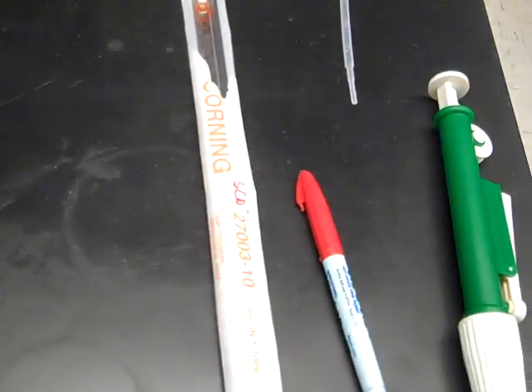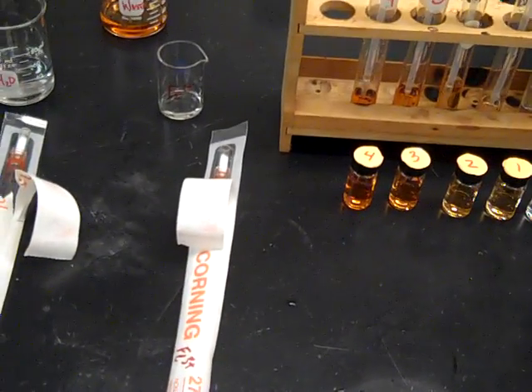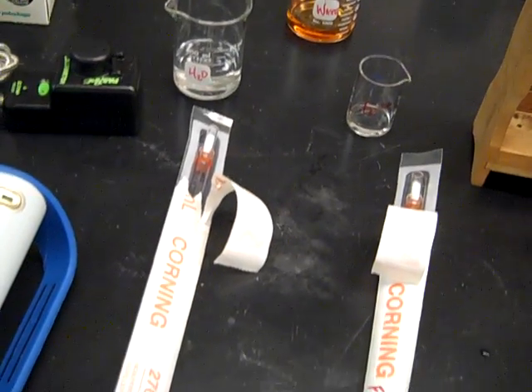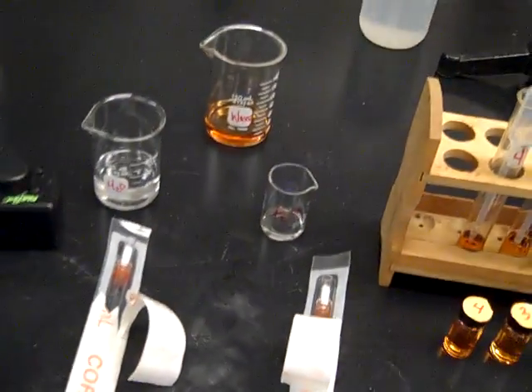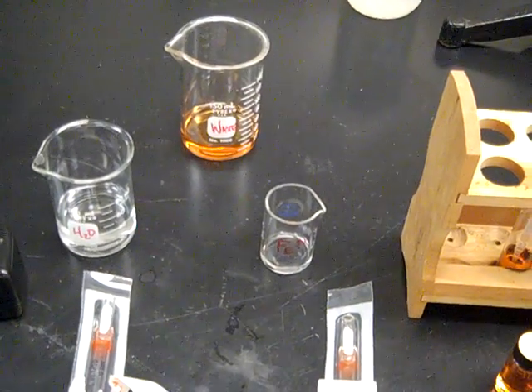Also, we have graduated pipettes for the thiocyanate, for the iron nitrate, and for the distilled water. And we have a beaker for the water. We also have a waste beaker for when you wash out your cuvettes.